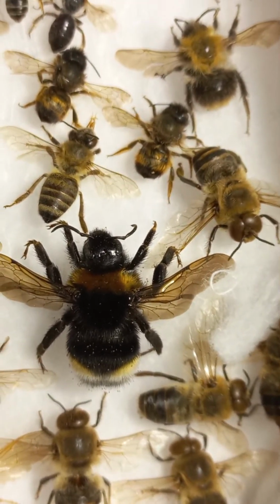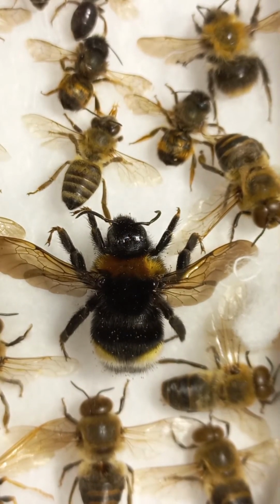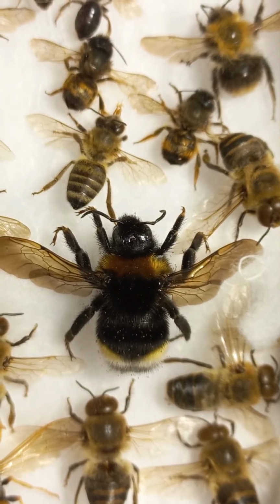For instance, today in the central part we are watching a bumblebee, which is a social insect.